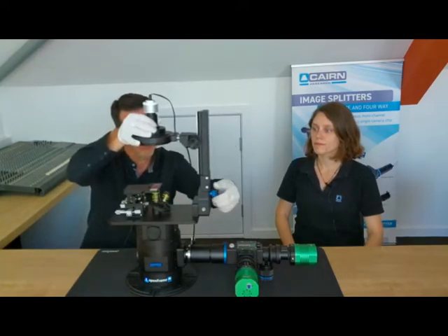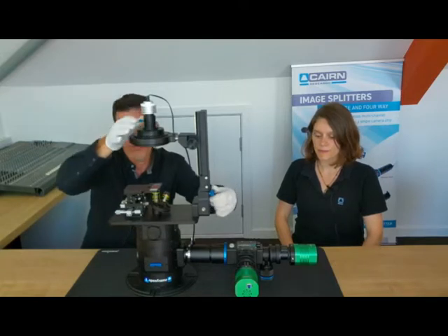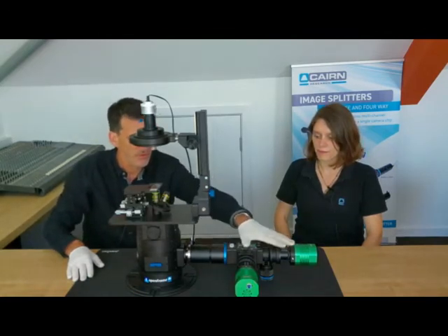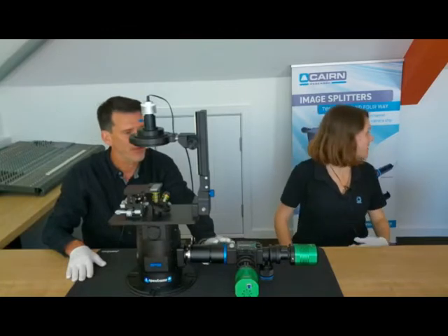And this device, although designed to fit very nicely on the openFrame, will also fit onto any conventional inverted microscope frame. We've set this system up with a twin cam with two of our low-cost CMOS cameras, and we're going to miraculously connect up a computer and show you a little bit of fluorescence and transmitted imaging.